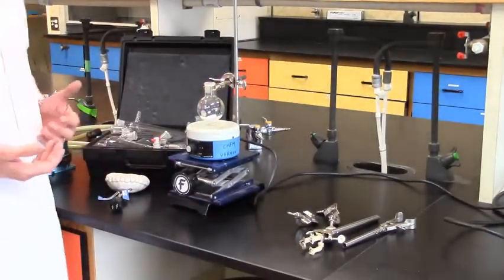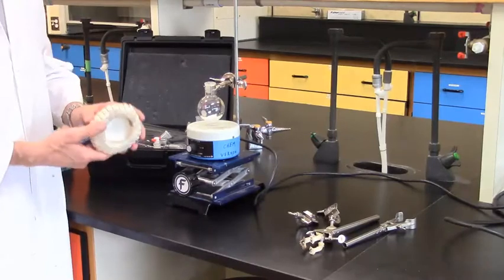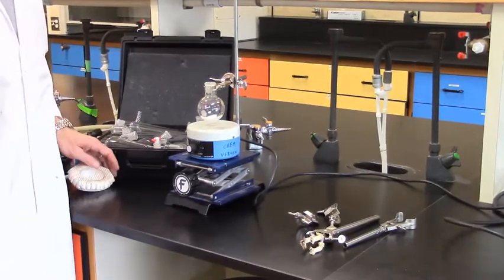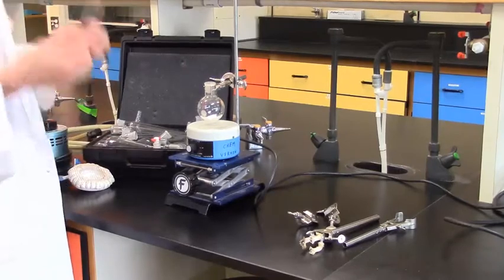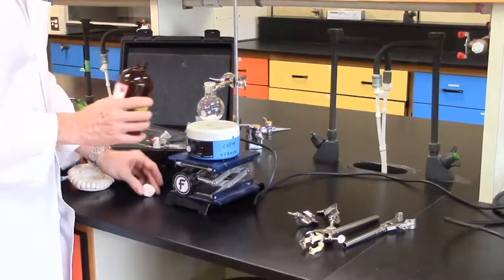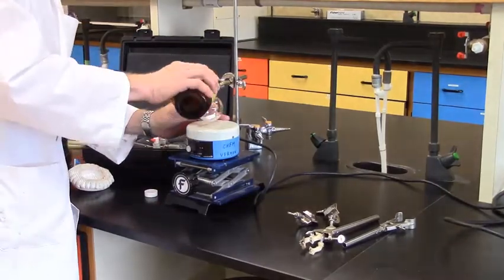Other times, we may want to use what is referred to as a heating mantle, and I'll show how that gets put together. So, I'll put my safety glasses on. I will introduce approximately 40-50 mils of diethyl ether into my reaction vessel.